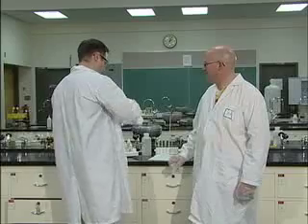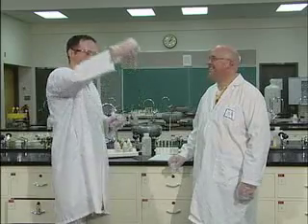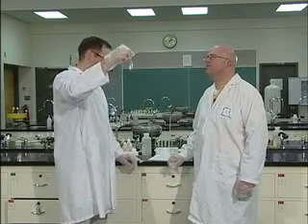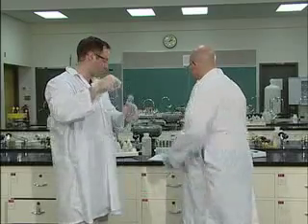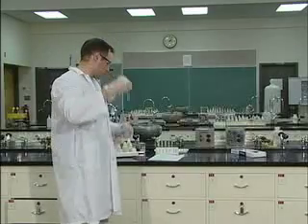Drops. Okay, so I've got approximately 30 drops in here. And again, we see it's about 6 mils, give or take. Again, it's a clear solution. Make sure, and I can't stress this enough, each time you're making observations, you note that it started off as a clear solution.